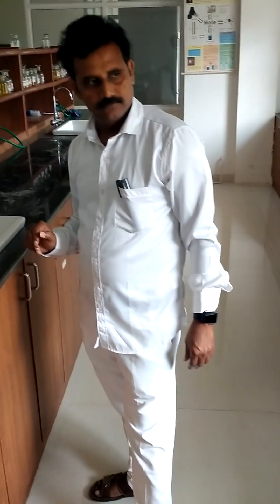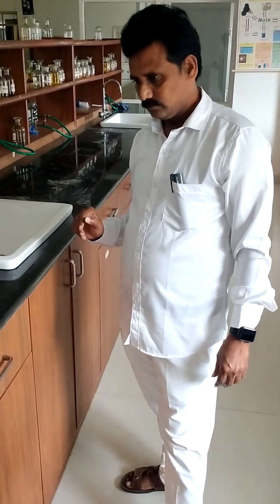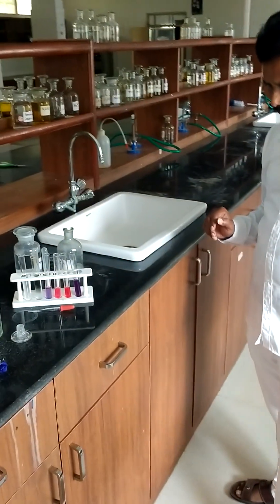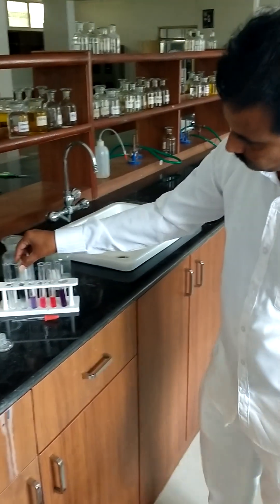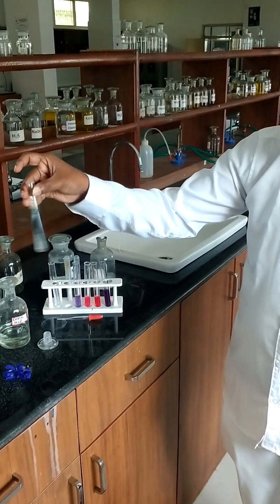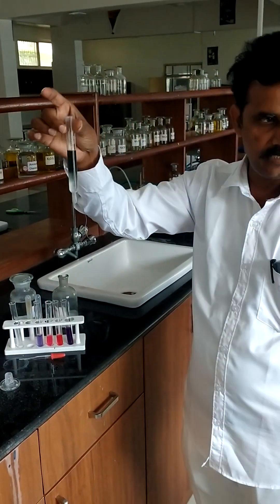Student: In the base medium, why is it not going down? Sir: If you mix it thoroughly, a completely uniform solution will come.